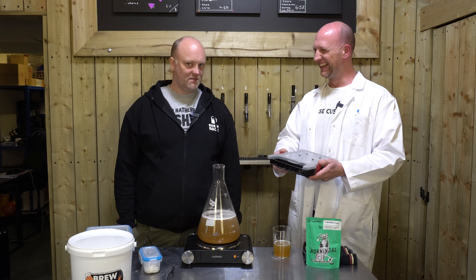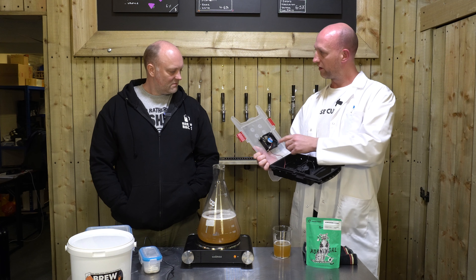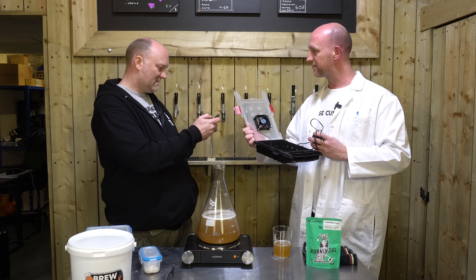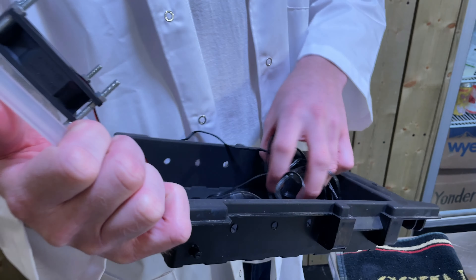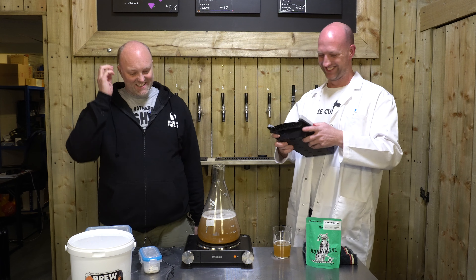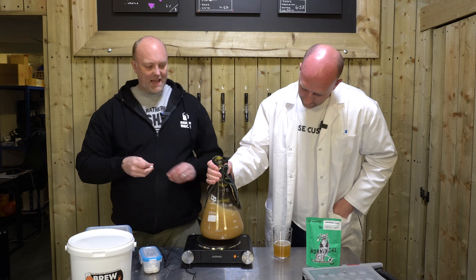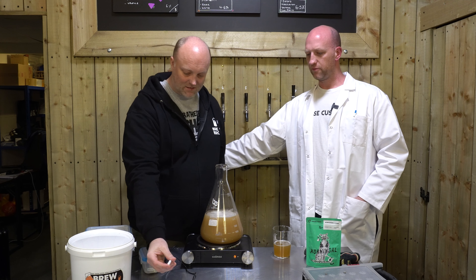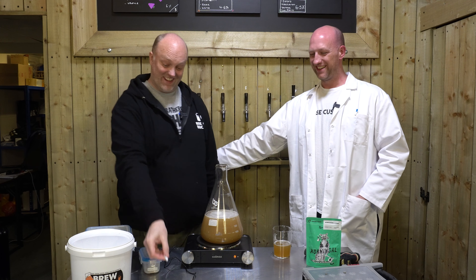I made this homemade stirrer a few years ago — it's a box that screws came in. It's got a little 12-volt CPU fan I bought on eBay with a dimmer-style controller, cost me about six or seven quid to make. But we're going to use the Wort Whipper from Kegland — super light, nice and compact. And then you get the little magnetic stir bar that sits in the flask — it's called a stir bar.